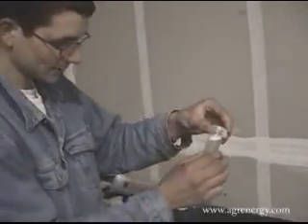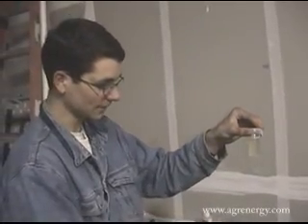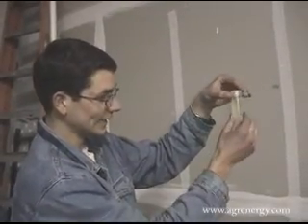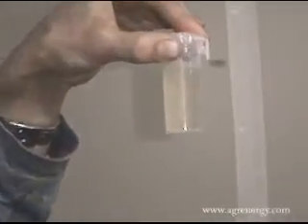Now what we're looking for is the fact that the biodiesel dissolves into the methanol alcohol. You see there it has dissolved. You don't see any bubbles of biodiesel floating around. In fact, you see a clear, bright, single phase here. No phase difference between the two liquids.